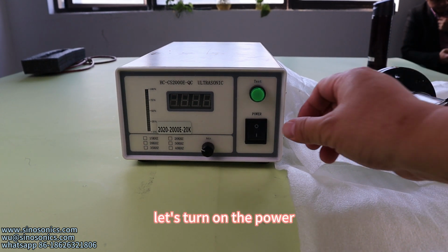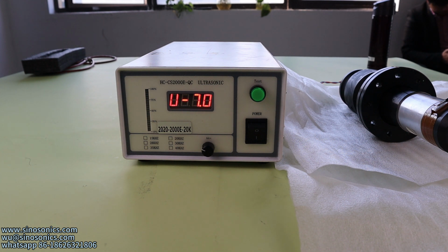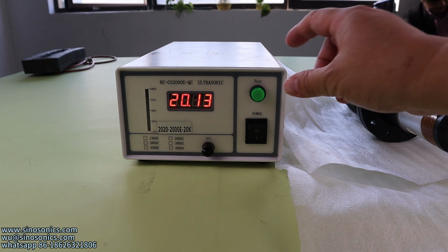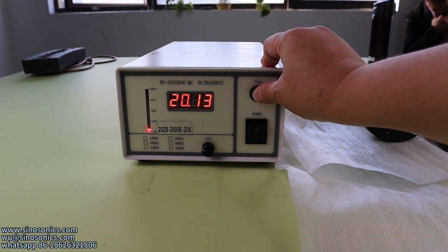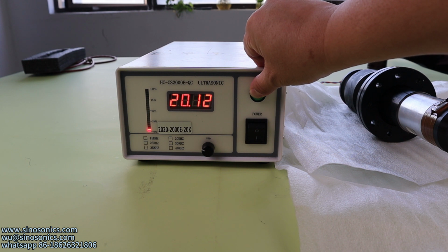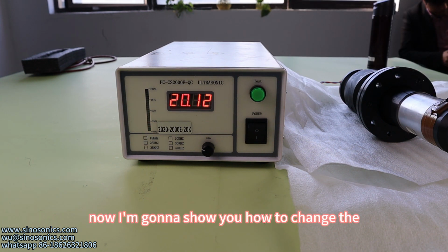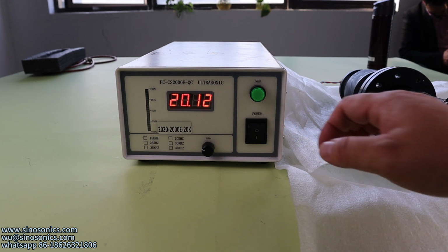Let's turn on the power. Okay, get the frequency. Press the test button. It will start working. It's working.